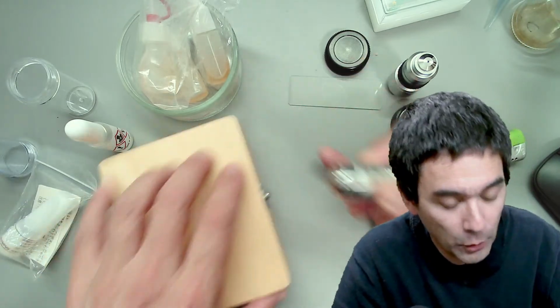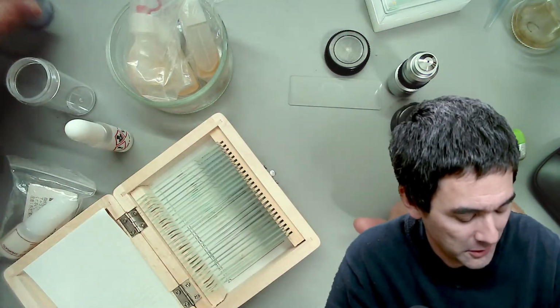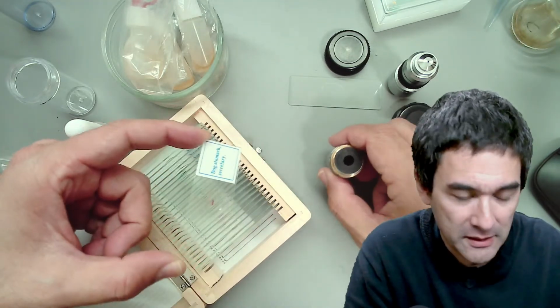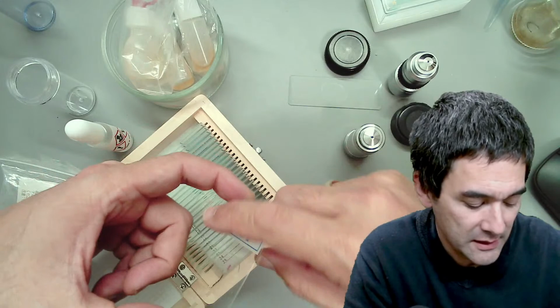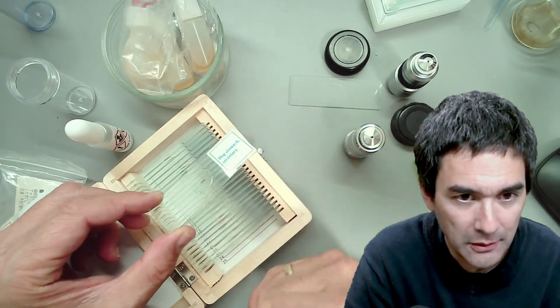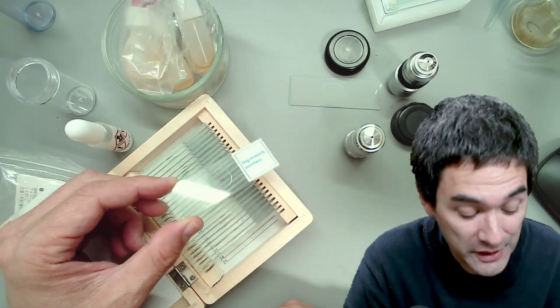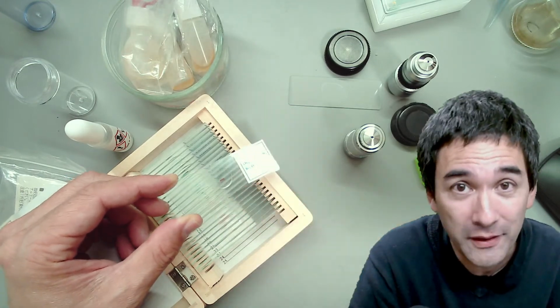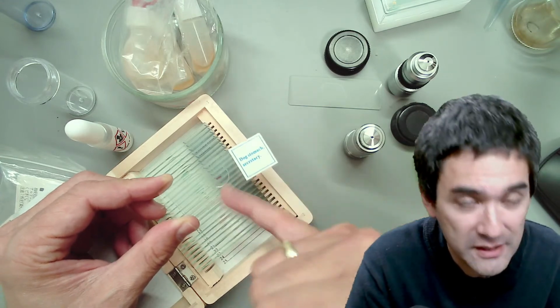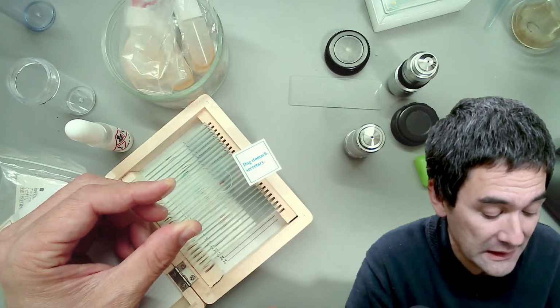Look, I've got a whole bunch of permanent slides here. You might have already seen them before if you joined my show last week. These are permanent slides, and those permanent slides, of course, have the specimen mounted in mounting medium. There's a label here, and you cannot use oil on those slides, or you should not use oil. The reason is that the oil is going to mess up everything. The oil is going to go on the label, then maybe the glue is going to come off. It's very difficult to clean it again.